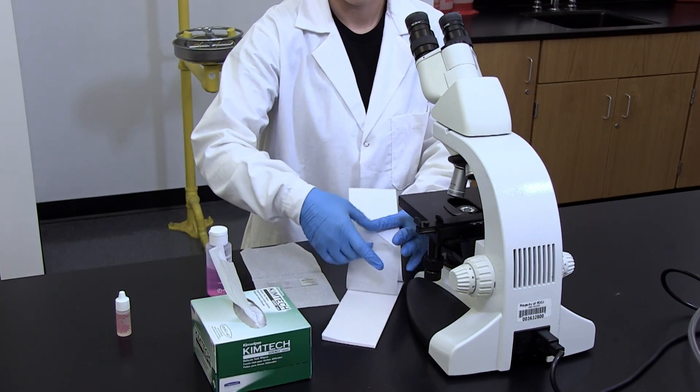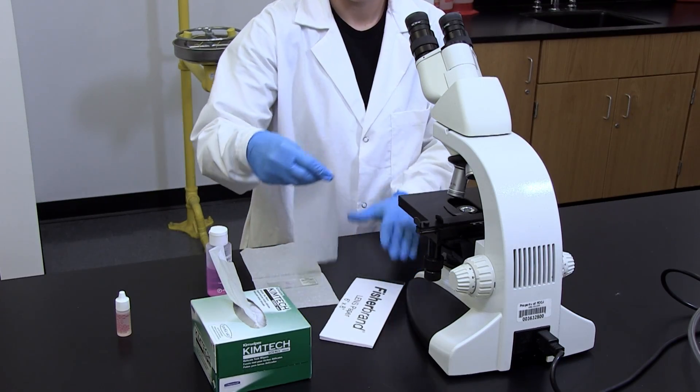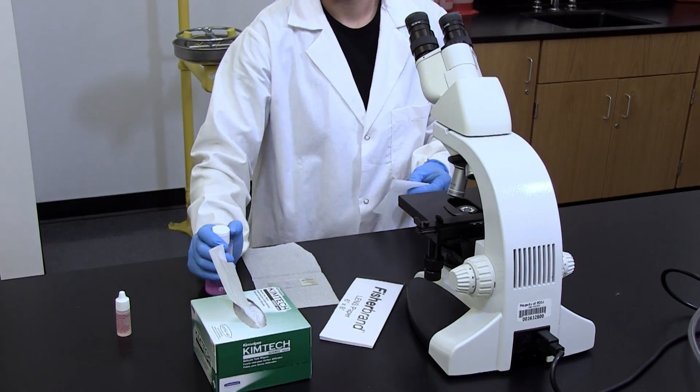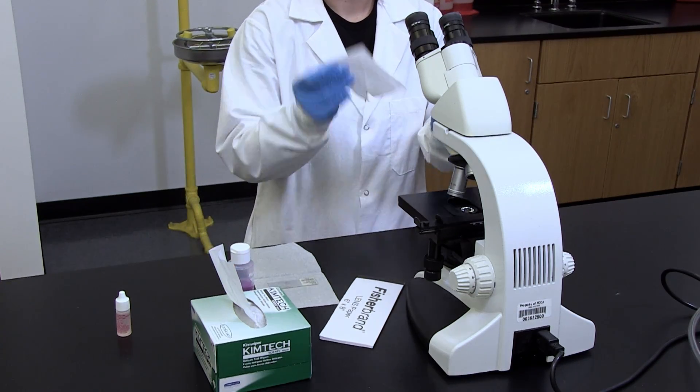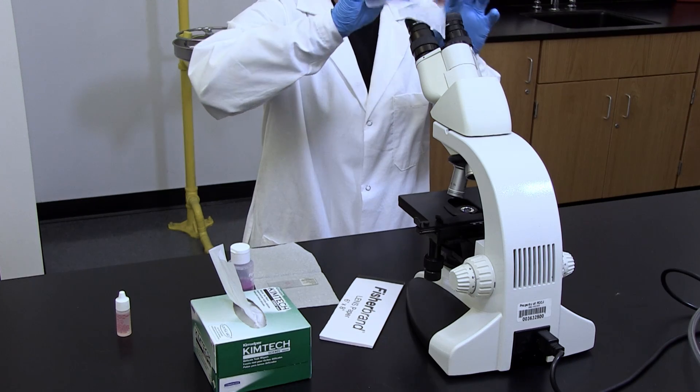Use only lint-free optical tissues or cotton swabs to clean lenses. If the lenses are quite dirty, a small amount of alcohol or optical cleaning solution can be used to remove oily residue.